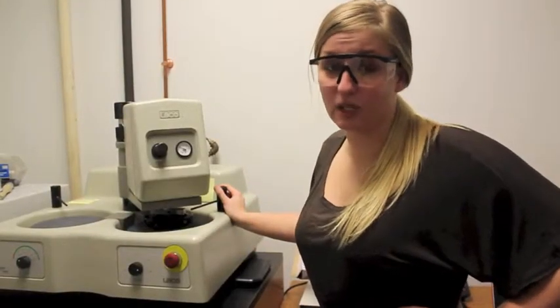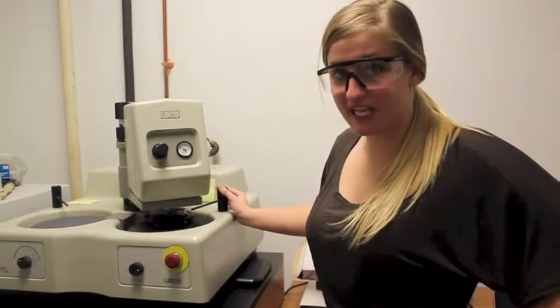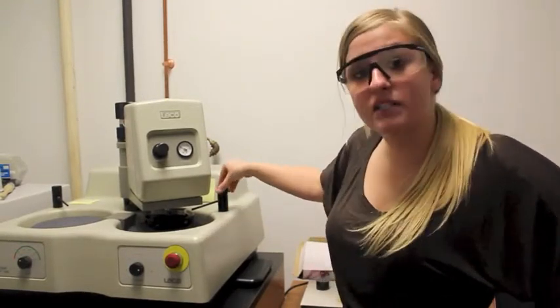For our example, we will be using water as our lubricant, which is activated by turning these spouts counterclockwise.